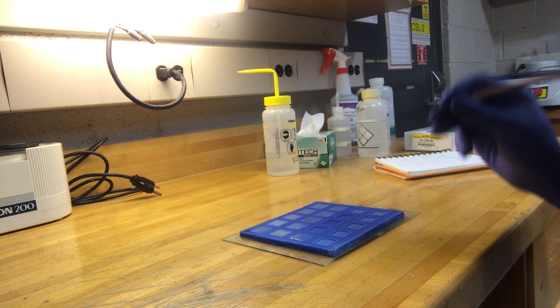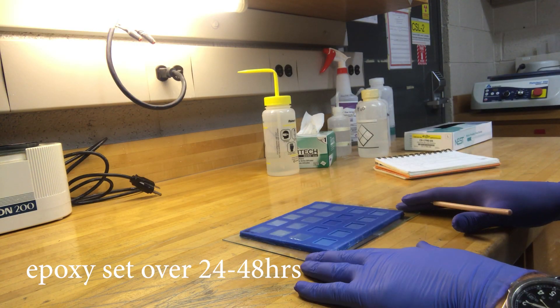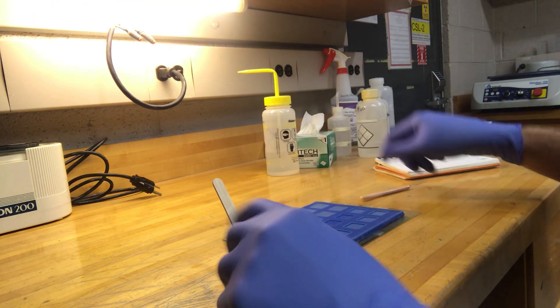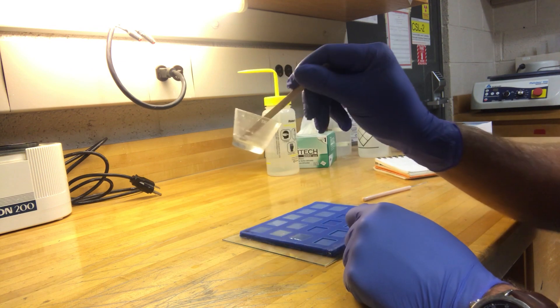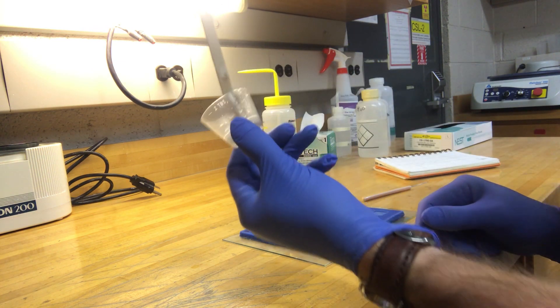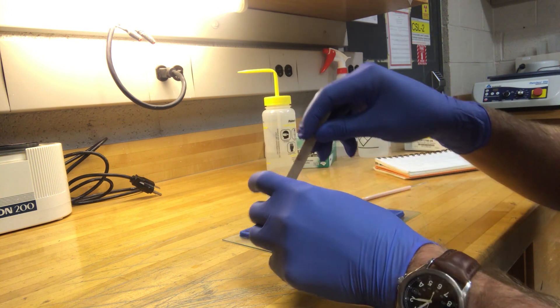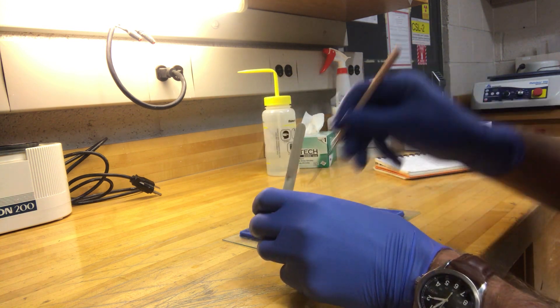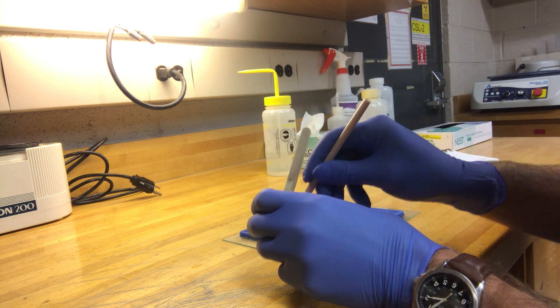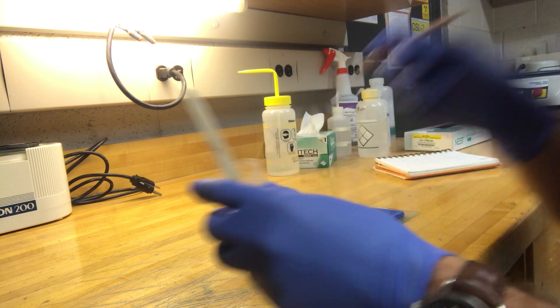Now assuming that the epoxy has set well, and we know that the epoxy has set well because we should have left our little popsicle stick in the epoxy. You can see that it is quite clearly set in there. It's nice and firm. You poke it with this little poking stick and it doesn't move at all. It's rock solid.